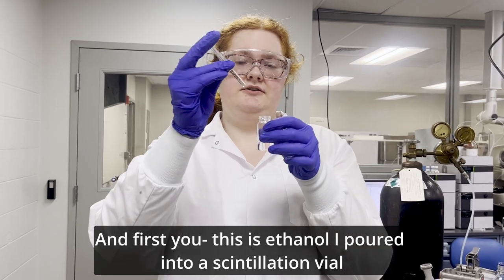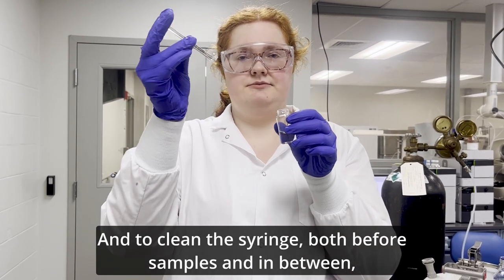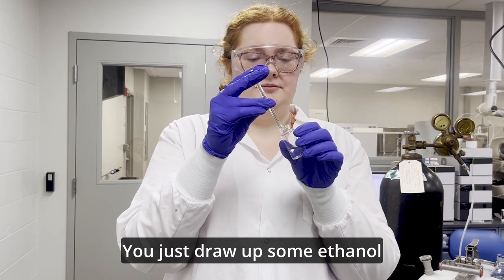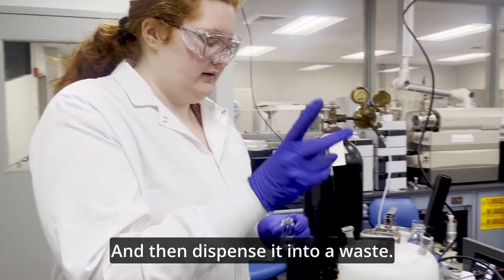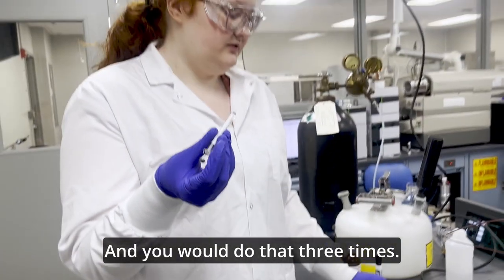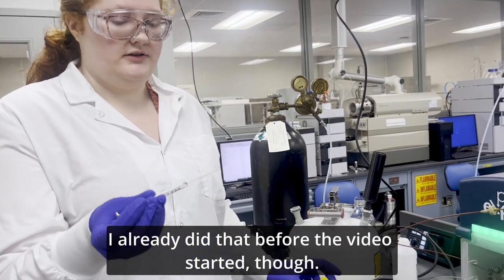I poured into a scintillation vial. And to clean the syringe, both before samples and in between, you just draw up some ethanol and then dispense it into waste. And you would do that three times. I already did that before the video started though.